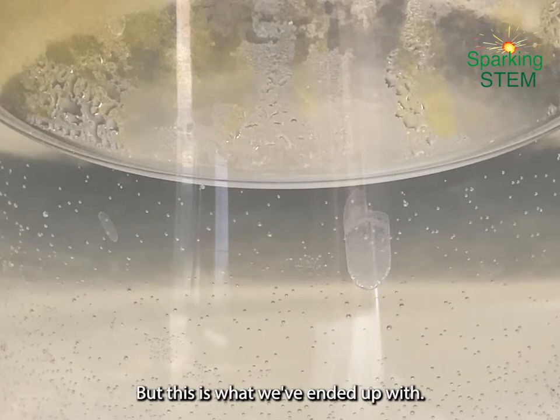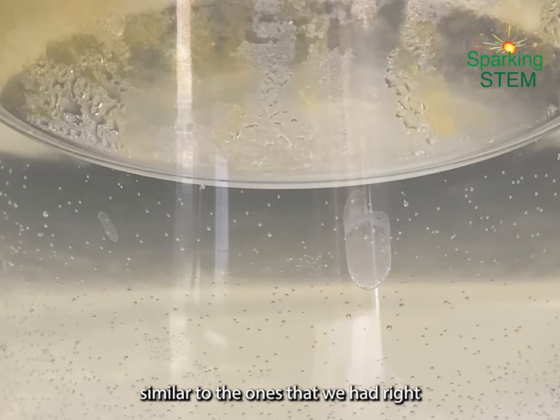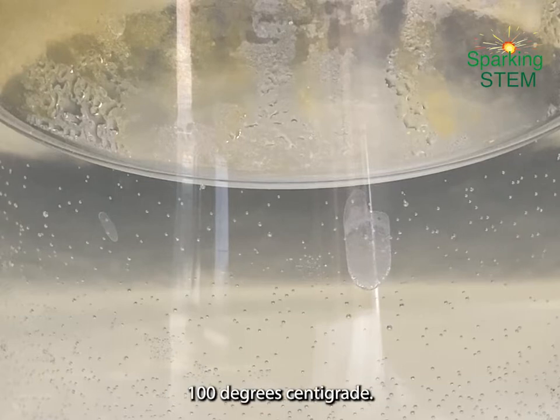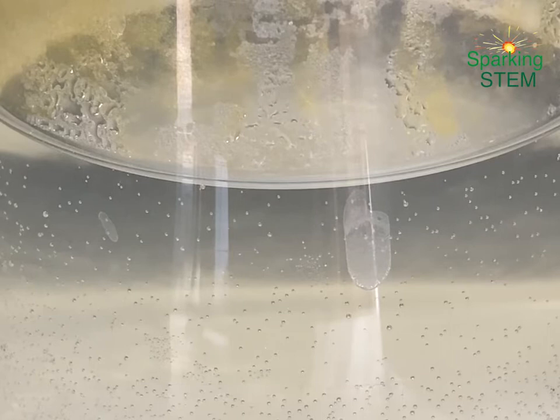But this is what we've ended up with. We're back to this sort of colourless, transparent solution, similar to the ones that we had right at the beginning. And it's starting to cool down. It was really quite hot, around 100 degrees centigrade. And I'm leaving it now to cool down. It's going to gradually lose that heat energy.